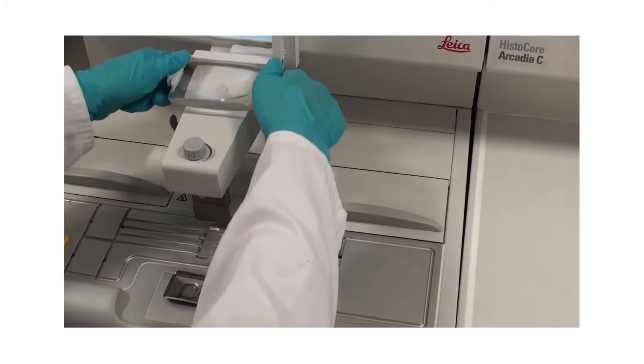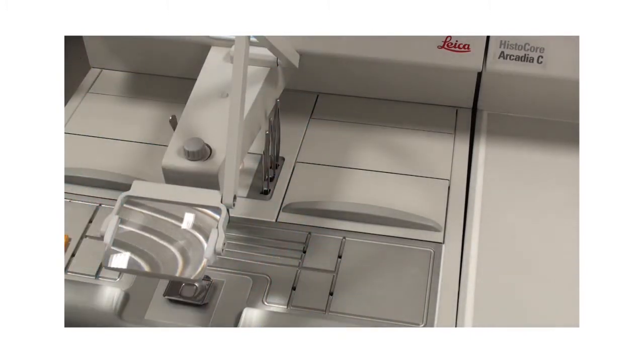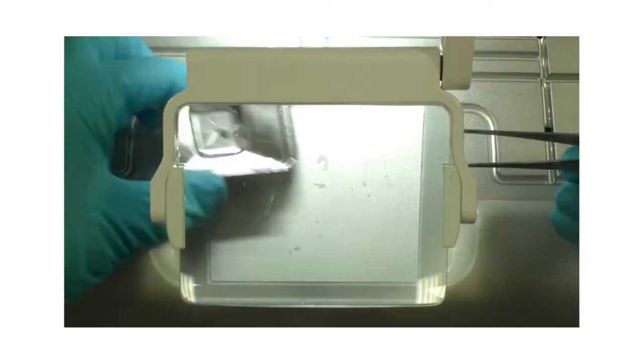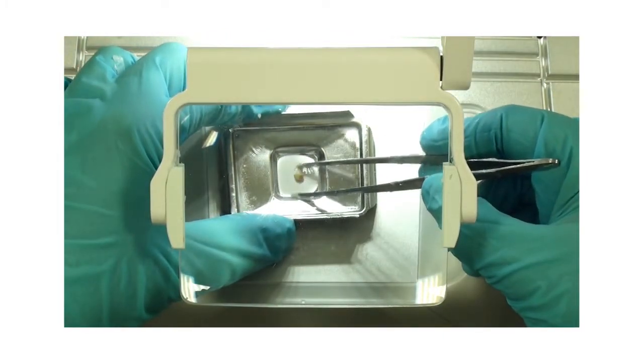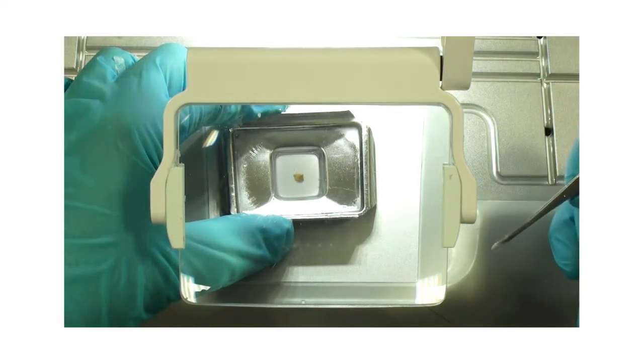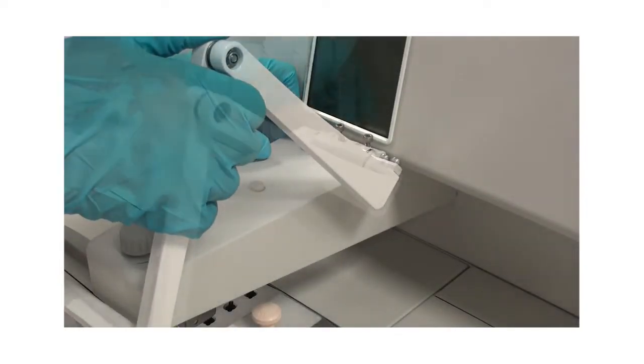To facilitate specimen orientation when embedding, the optionally available magnifier provides a clear view of the work area. The magnifier can be installed in the two tap holes on the dispenser with a screwdriver.